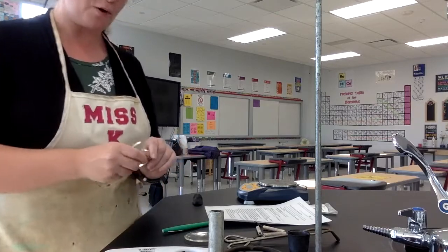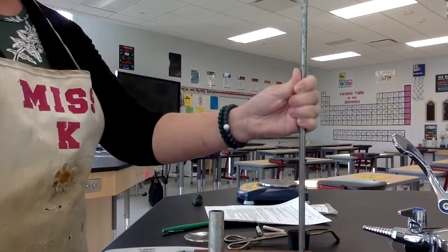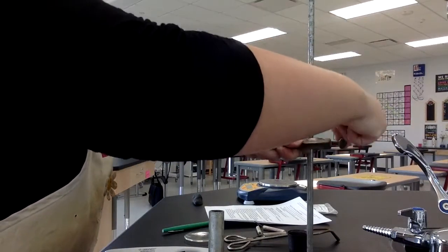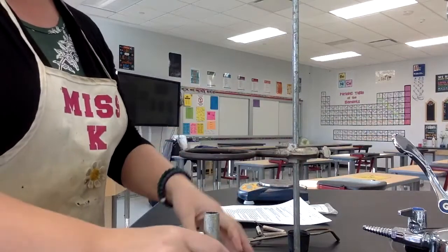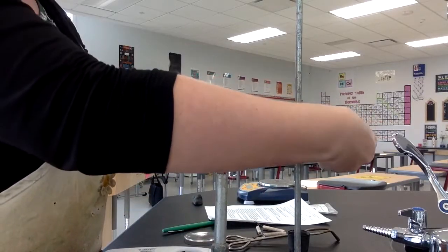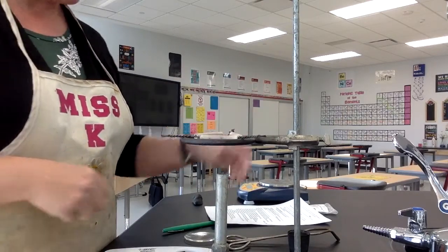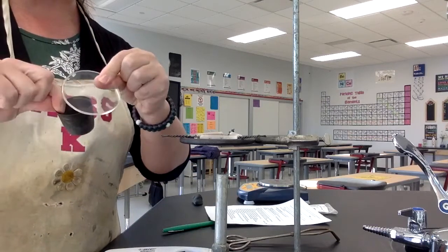Here we go. So the first thing I'm going to do is I'm going to set up my ring stand setup. So I've got a ring stand here. So I'm going to put a metal ring on it. And the metal ring will hold my system. All right. Okay, so I've got my ring there, and then I'm going to put the Bunsen burner underneath it pretty close because I want to heat this pretty strongly. I might move it up a little bit. And then I've got a clay triangle. That clay triangle is on the ring. That will hold my crucible. And then that's all. I'm going to use a watch glass as a cover.